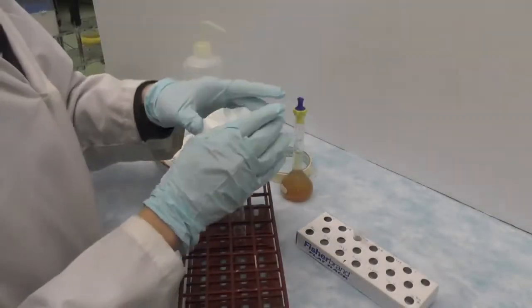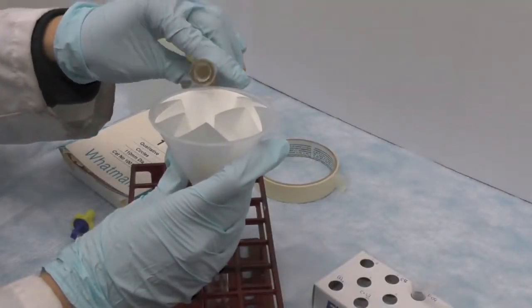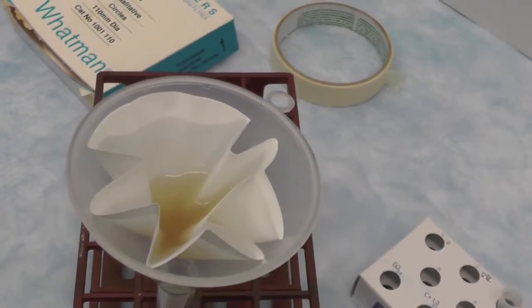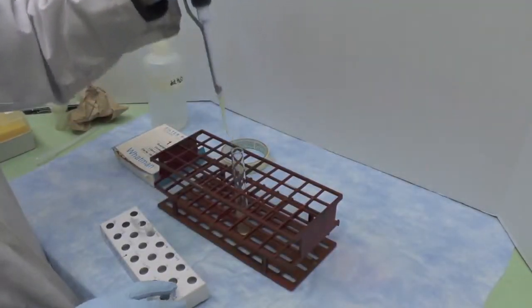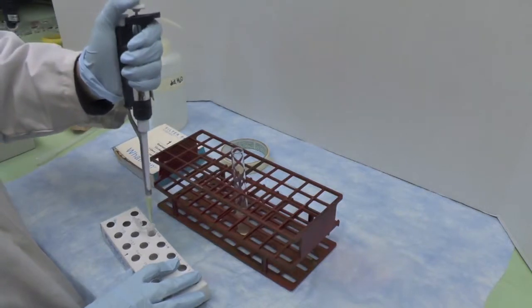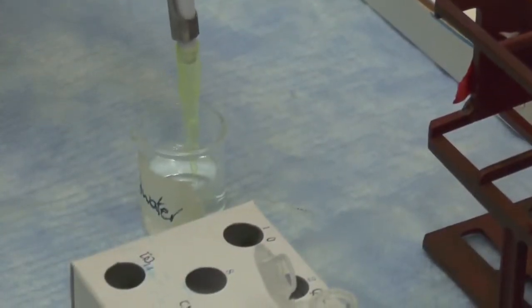Filter the apple puree solution into a test tube. Refer to your pre-lab calculation to get an idea on how much solution you will need. Dilute the apple puree to reach 250 µg sugar per milliliter concentration in DD water in a microfuge tube.